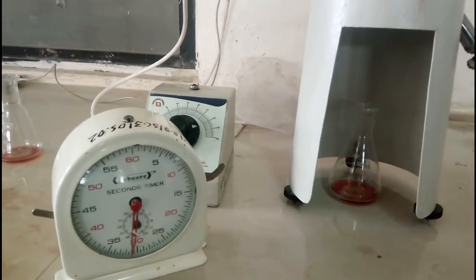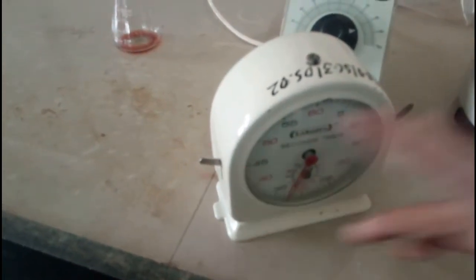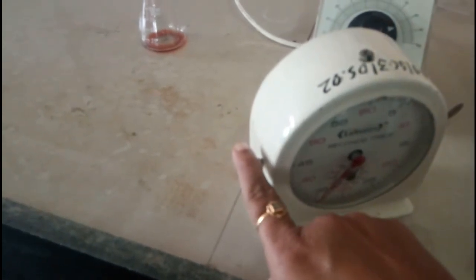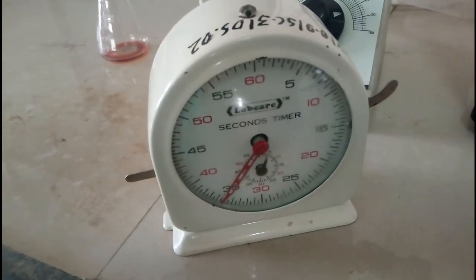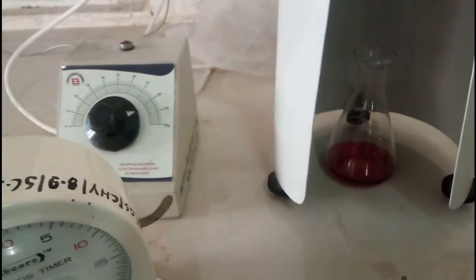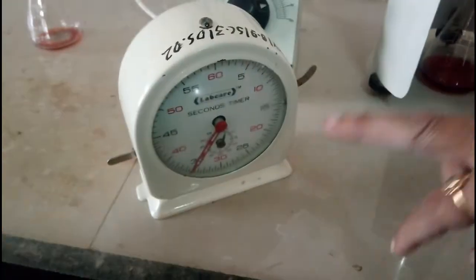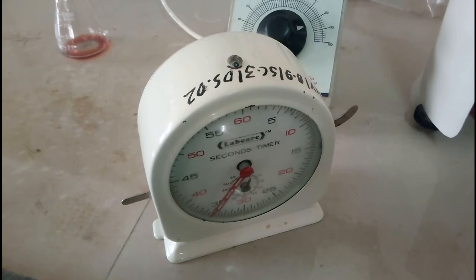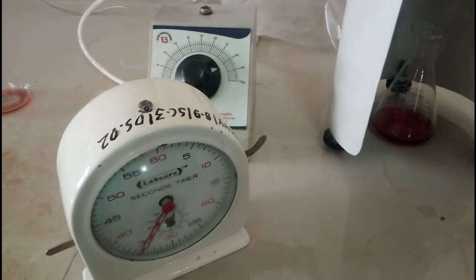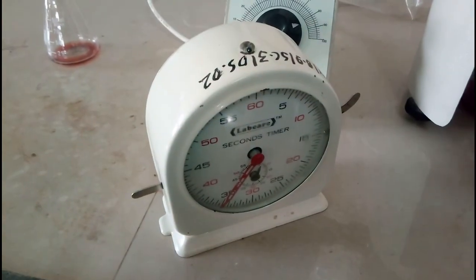All the oil is collected. Now we are going to stop the stopwatch. You have to record the time required, the temperature of water, temperature of oil, and the flow rate. The flow rate means you are going to record the time required for 25 ml oil to come from that jet to the flask.